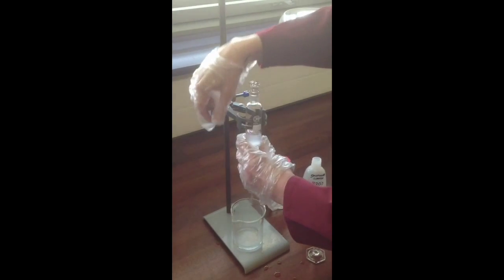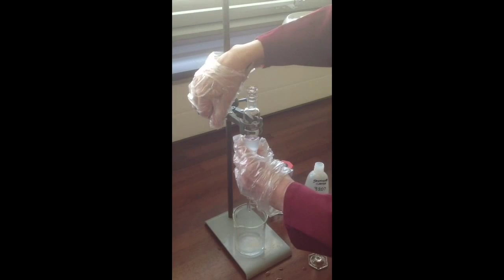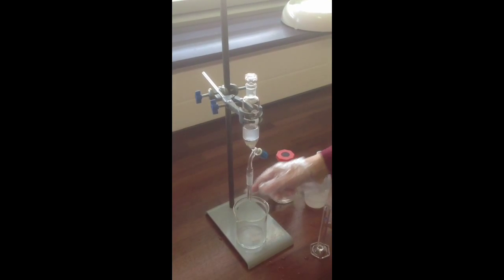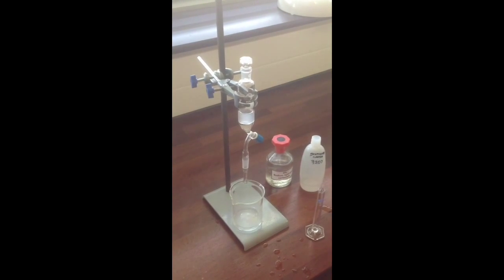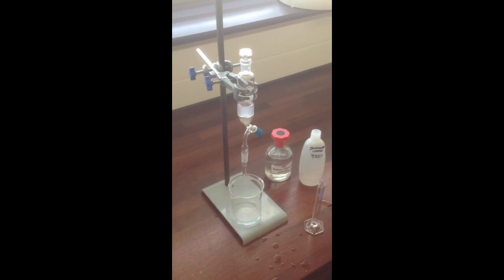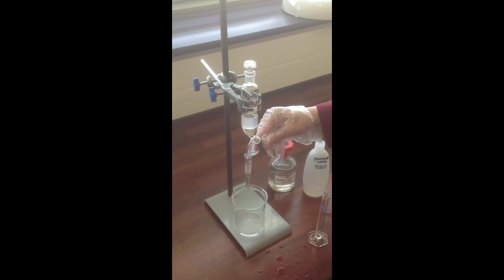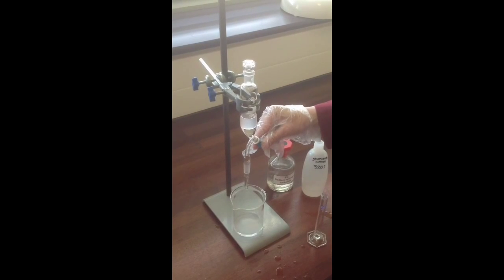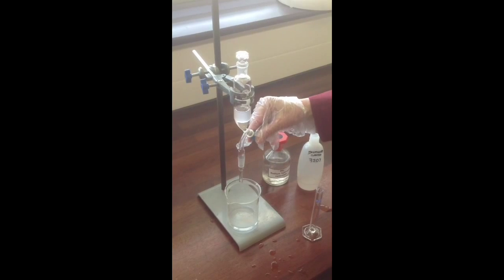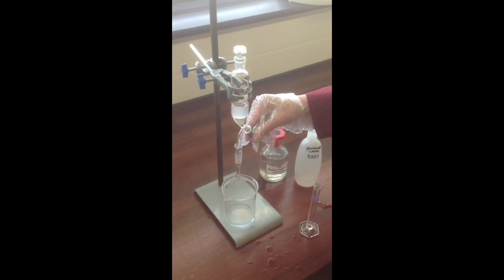We'll show you at this point one common mistake people make, which is to leave the stopper in the top of the separating funnel. If you do that, when you go to drain out the lower layer, you'll find something surprising happens. A few drops come out initially, and then nothing seems to happen. And at this point you'll be under the impression that your tap isn't working.